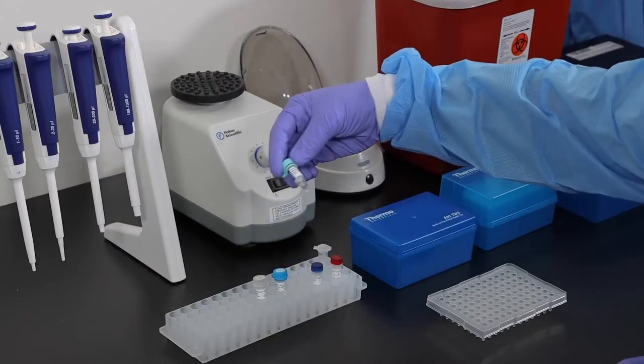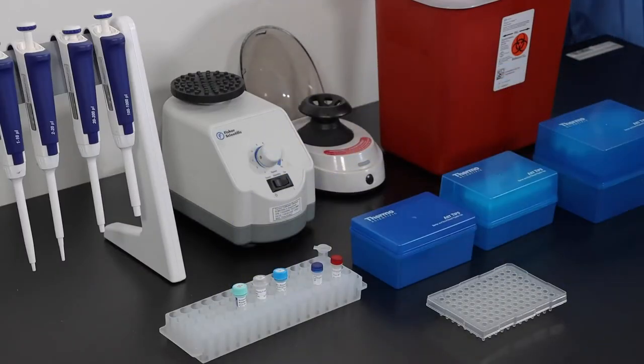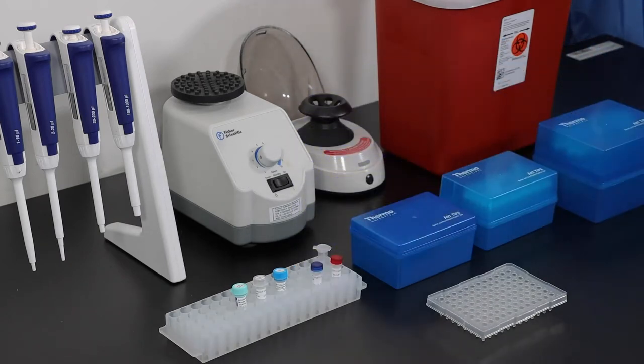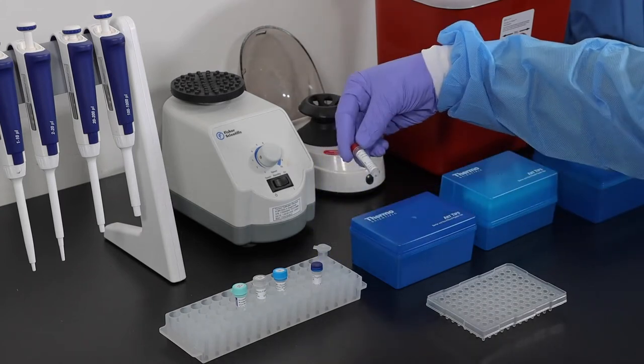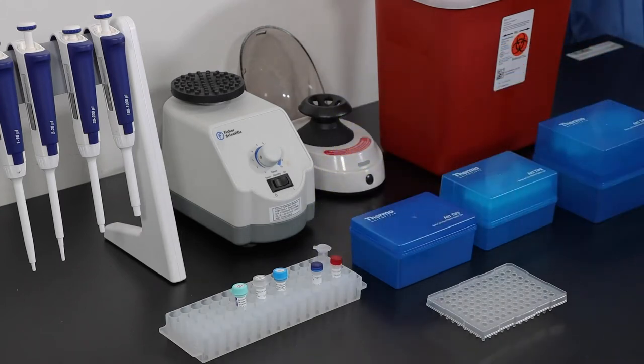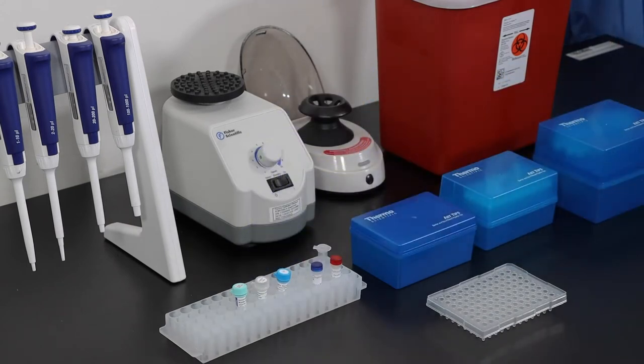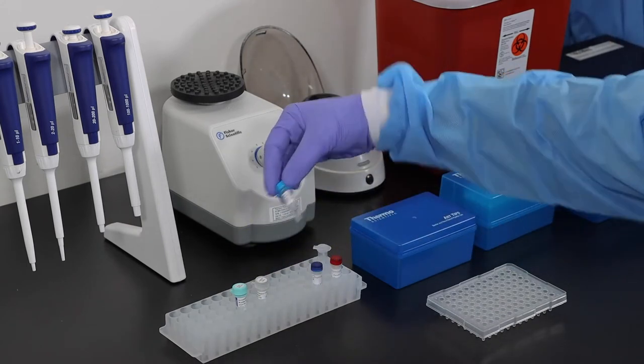You will need the following reagents: Access quick master mix, RV primer set 1, PCR positive control, nuclease free water, and AMV reverse transcriptase.